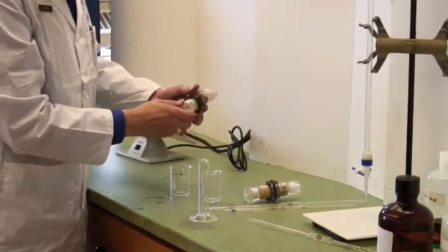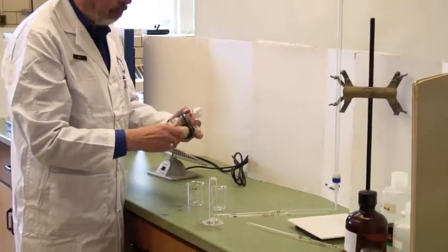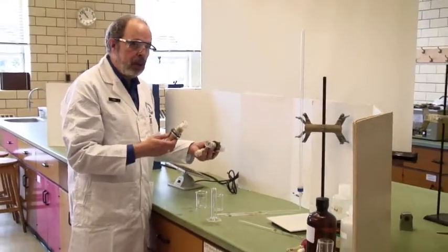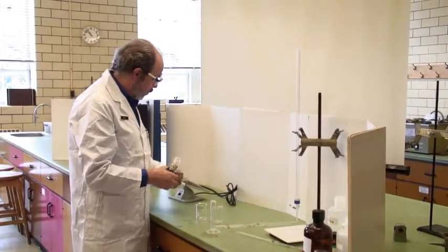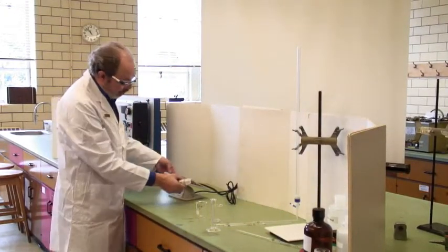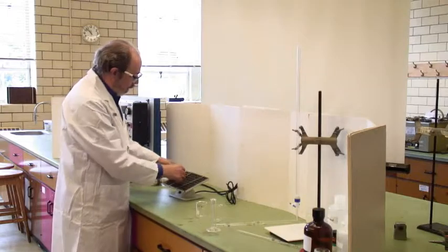We've got three cells here, and you can actually have more than one going at a time. And we've got multiple ways for them to be agitated. The first and the easiest one is this little rocking table.